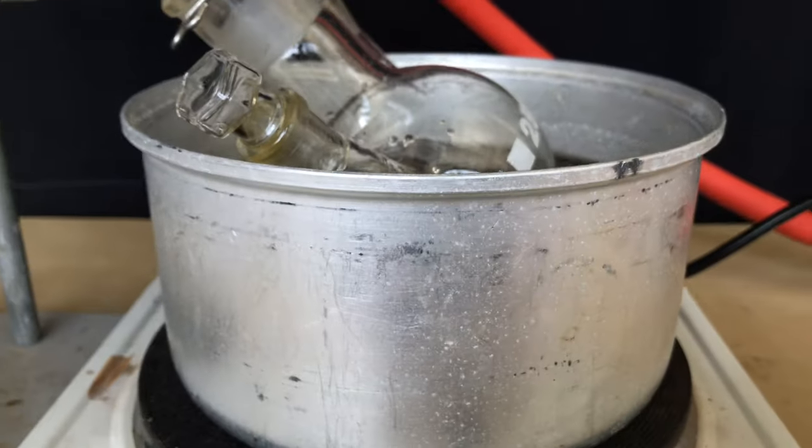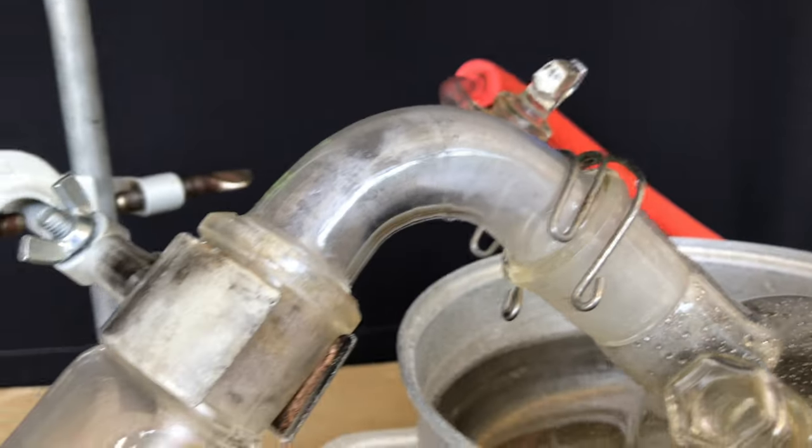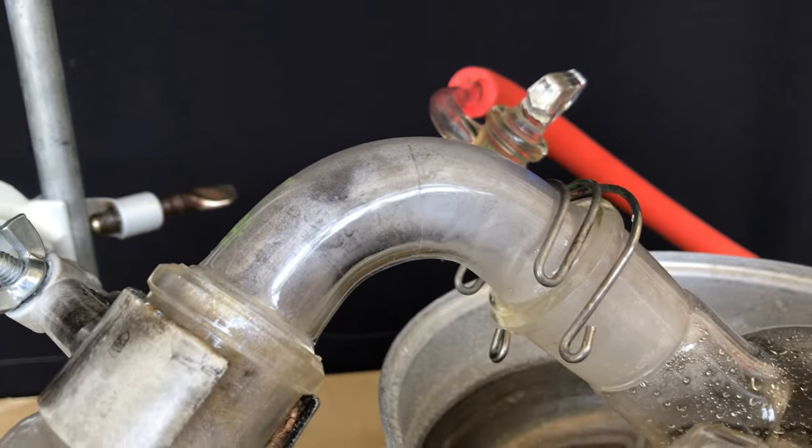I am lazy and I am therefore going to heat the flask in a pot of boiling water. It did not take long for the solution to start boiling and after about 2 hours most of the liquid was gone.